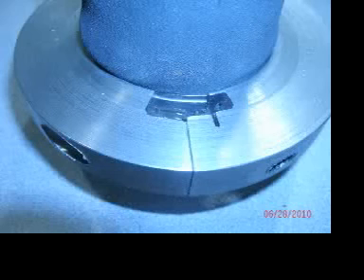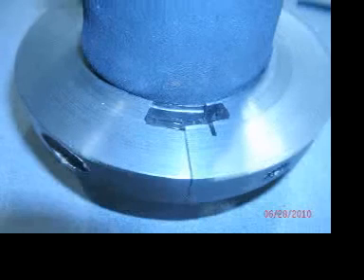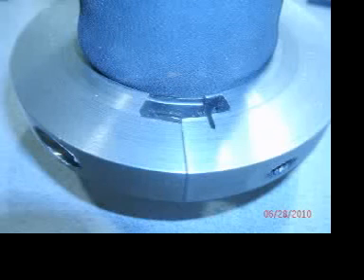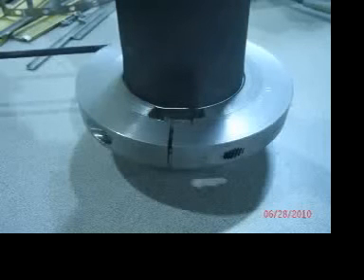If you don't have them lined up horizontally, you won't be able to get the two ends together. But that is not a major catastrophe, because then all you have to do is just loosen up the fixture, reposition the clamp, put the fixture back on. Don't take the fixture off, just loosen it up. And make sure that your shim is still in place. And with everything correct, you should be able to have it about like that.